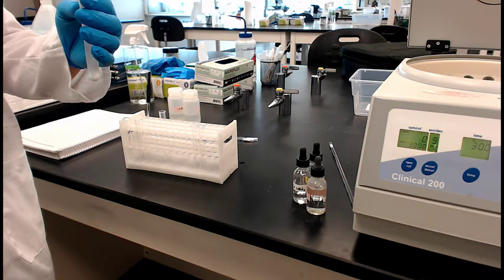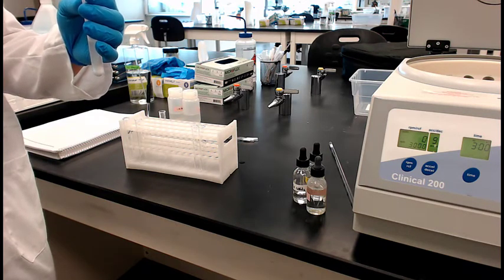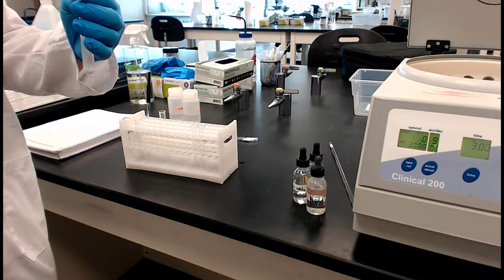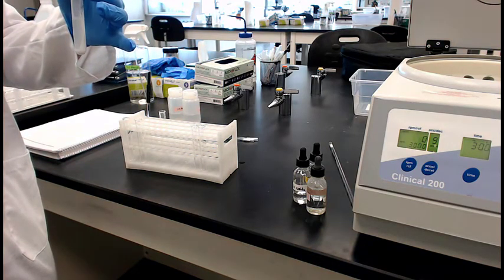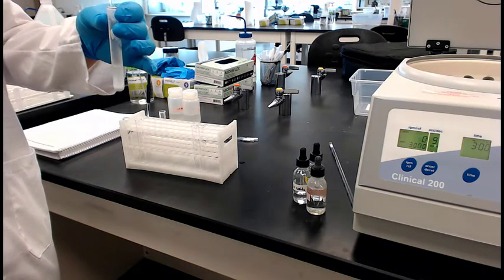And what he's going to do with that clear fluid is he's going to split it into 2 tubes and we're going to play with it. We're going to do some different things with it. All right. So you just see how he's drawing it off the top, trying not to disturb it too much because the solid's all settled on the bottom, and that's fine.